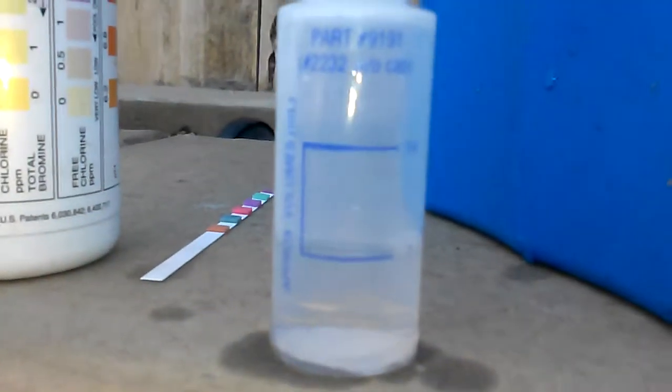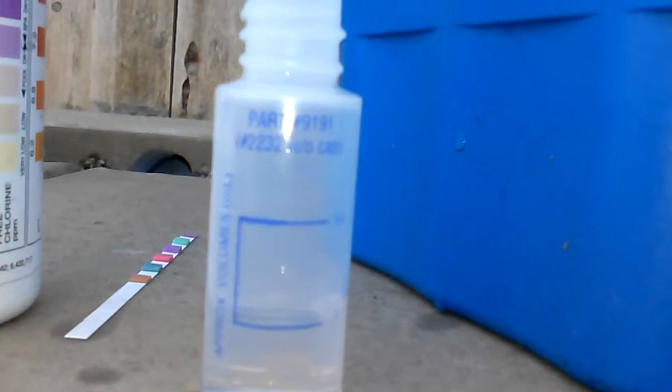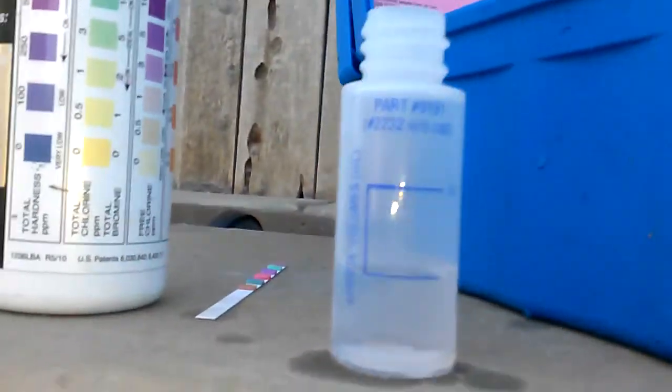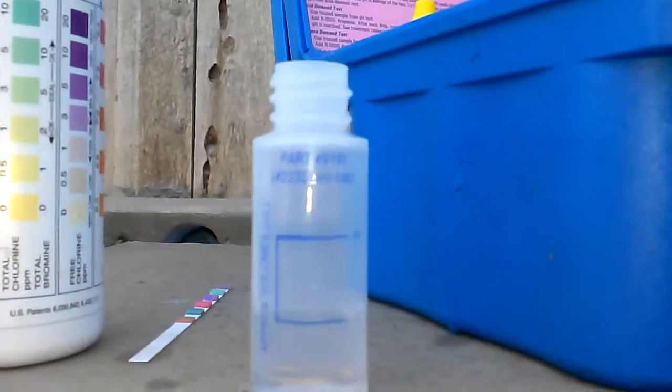Okay, first thing you want to do is fill your vial—it comes with a little vial here—you want to fill it up to the first line with just your water out of the pool.